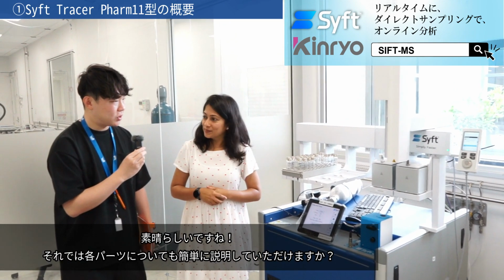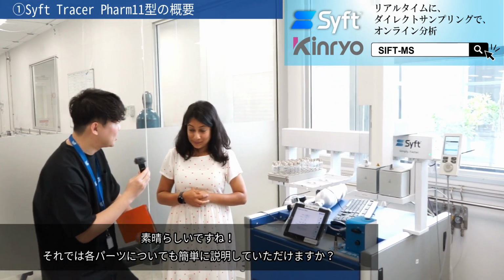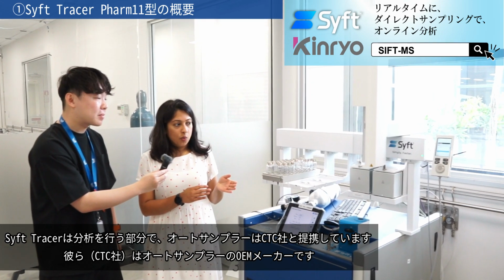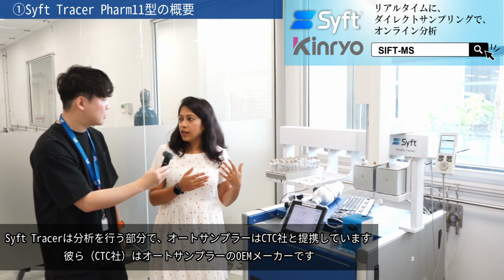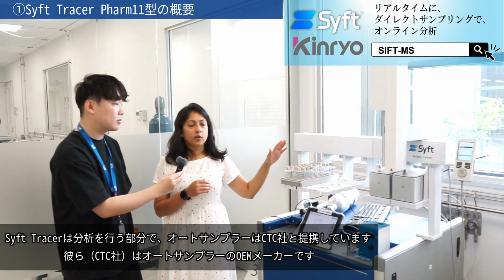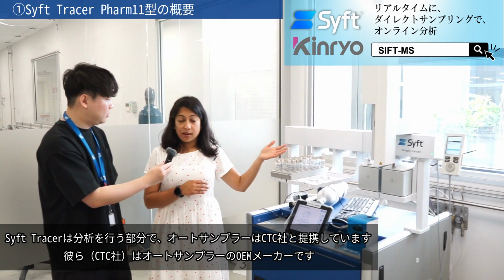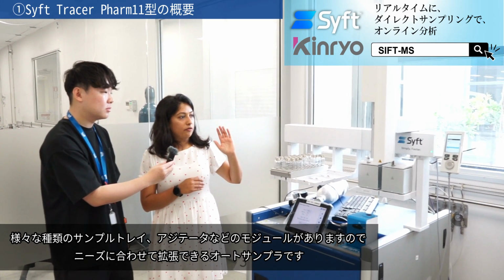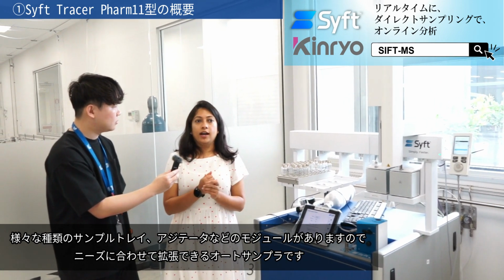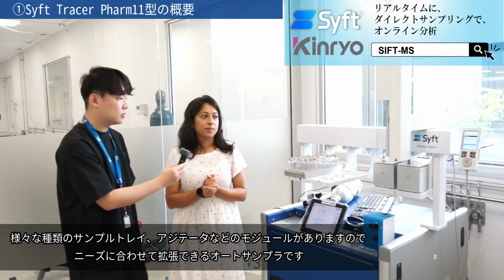Very nice. So maybe you can quickly tell us what parts? Yeah, sure. So the tracer is what analyzes. The auto sampler we have partnered with CTC. They are the OEM for the auto sampler. We've got different kinds of auto samplers. So it basically is an architecture that can grow with your needs.